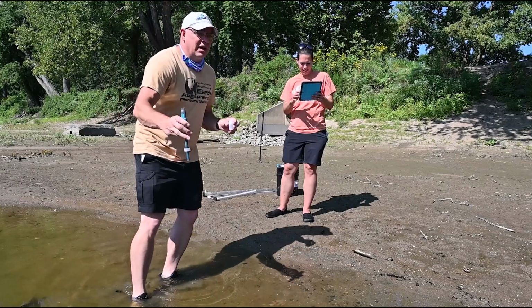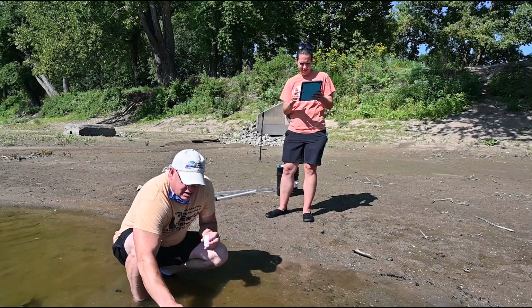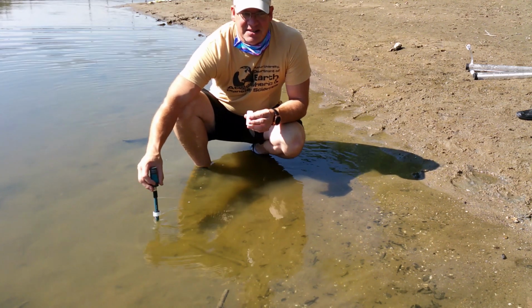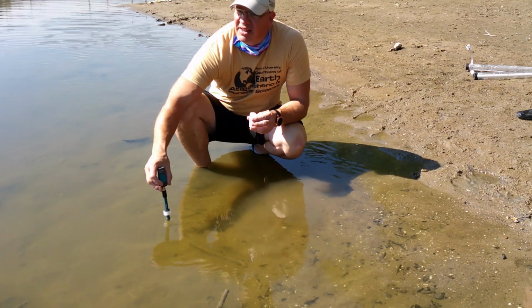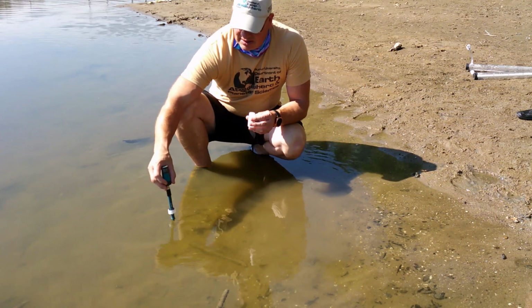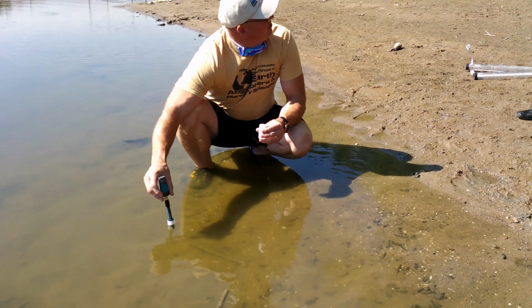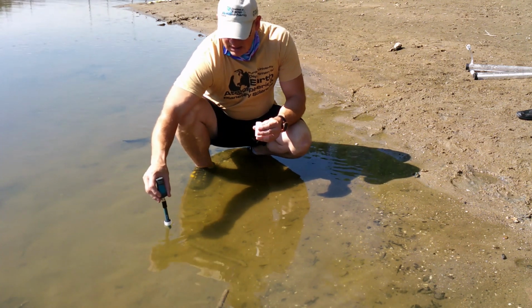Then I will pick our site just like the other times, the same spot because this is our area. I'm going to swirl that around for a minute or 2, not violently, but just mix it around. Sarah's collecting. It's nice when you have a team, so one person can step into the water and the other person can keep her feet dry. Although Sarah never keeps her feet dry. Right now the pH has reached 8.02.